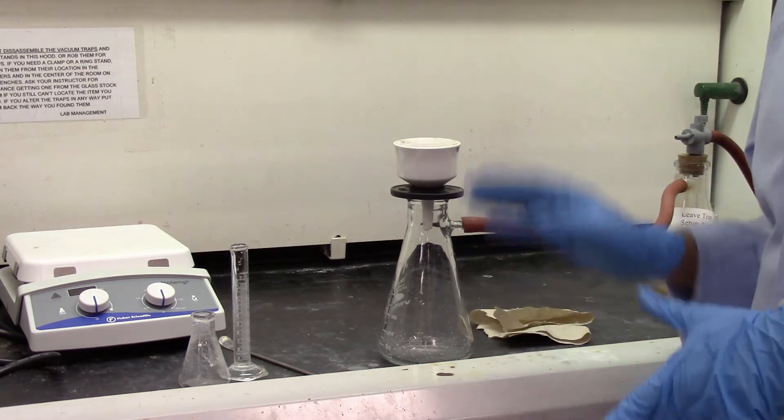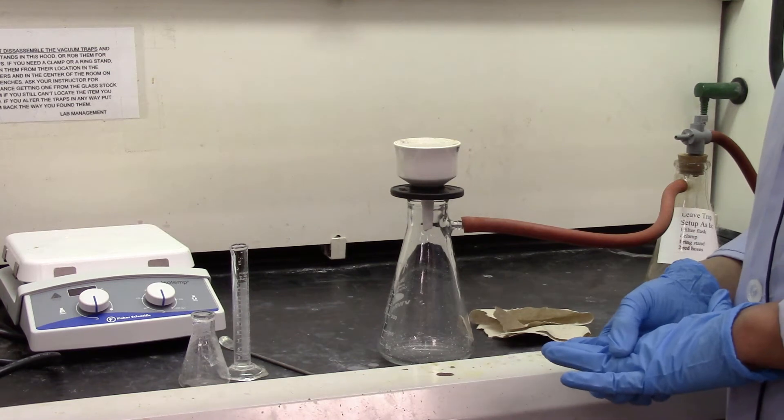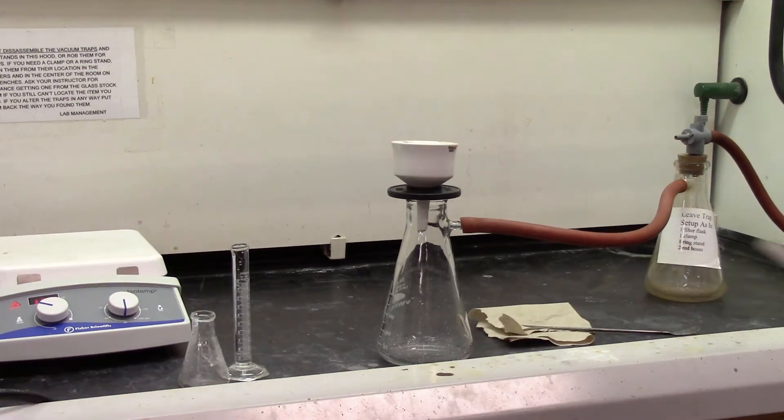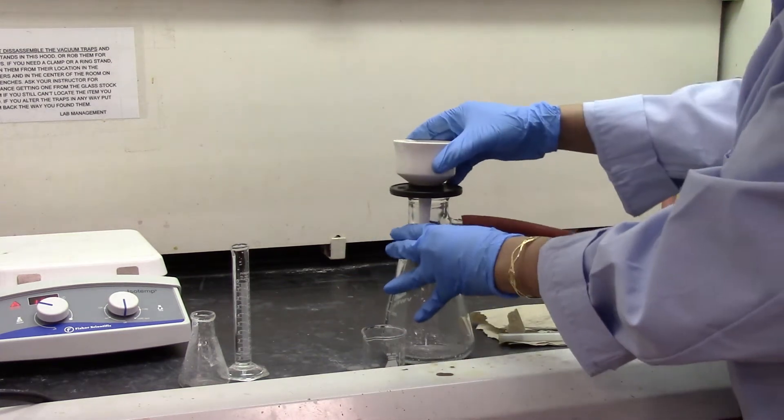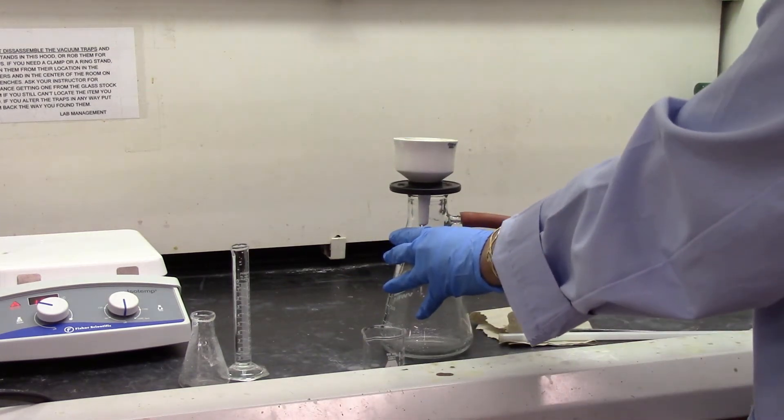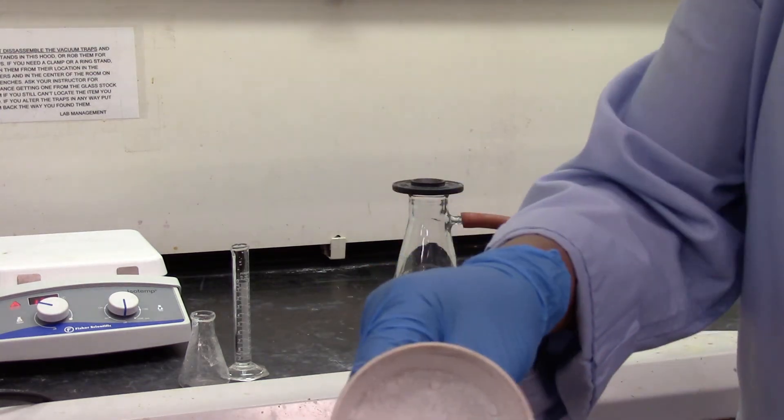So I'm going to let it sit in the vacuum for a few minutes to have it dry and then proceed. So it's been sitting in the vacuum for a few minutes now. I'm going to turn off the vacuum. And as you can see here's my product.